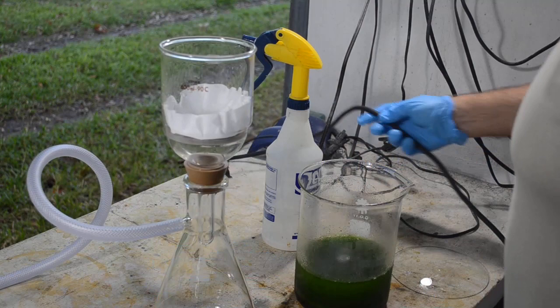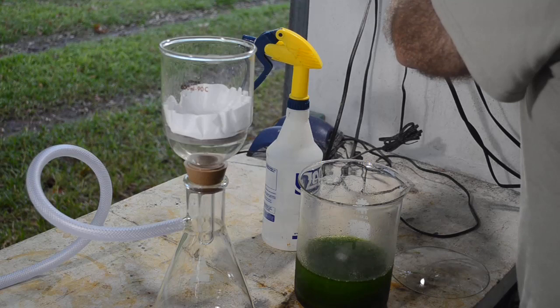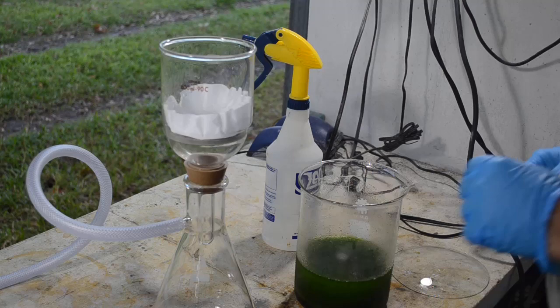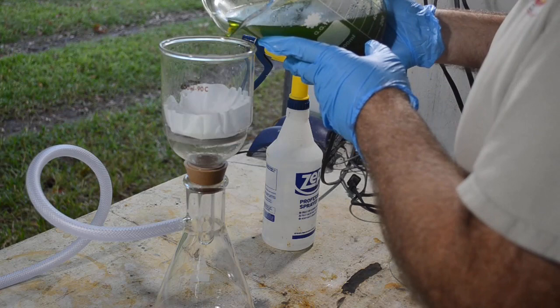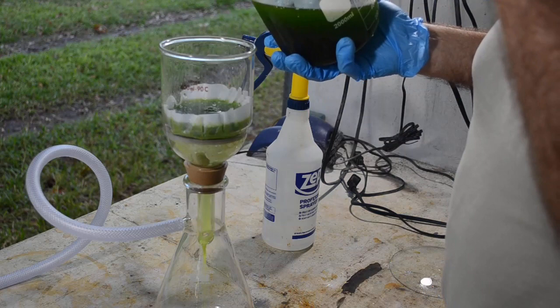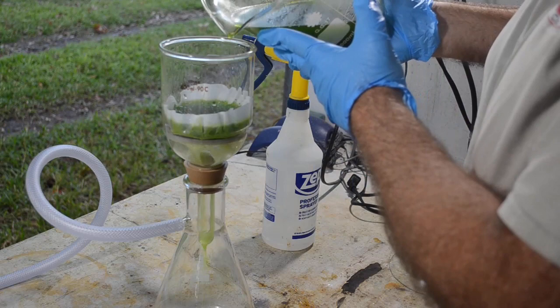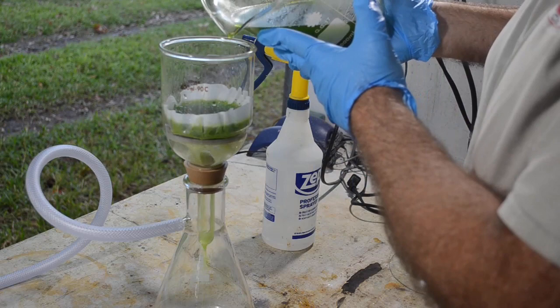Getting a little bit smarter in my old age. Got that rattle-trap of a vacuum pump off the top of the bench now so it doesn't shake everything — should have done that years ago. Obviously there's some copper in here; I wouldn't be surprised. Probably some of those copper dendrites on the copper cathode fell off and wound up in the anode slimes, and there are probably other copper compounds in there too. It looks like the filter's plugging up already, so it's probably going to take a while.